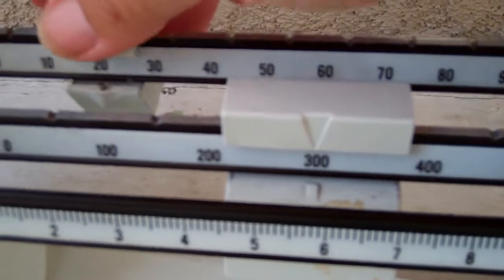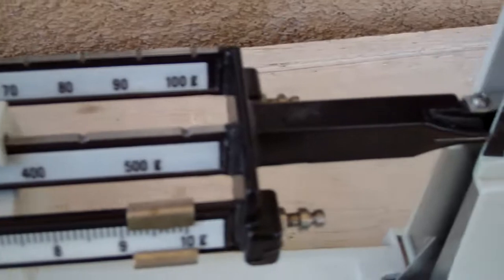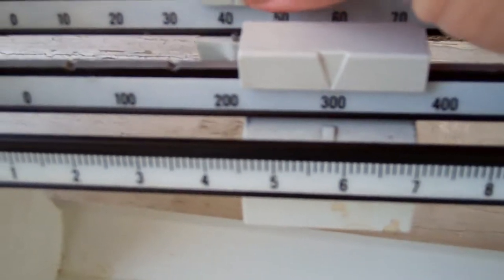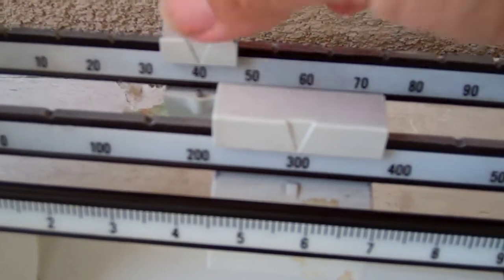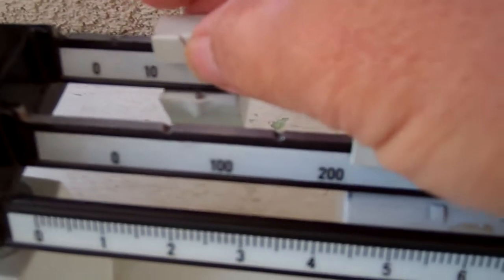So I'm gonna go and move this one around. Move that there. Move these around. That's too much. It's down. Still going down. We're narrowing in on the mass of the object.